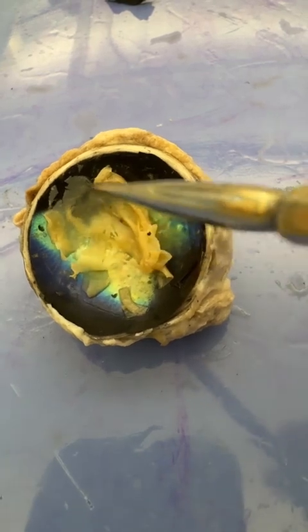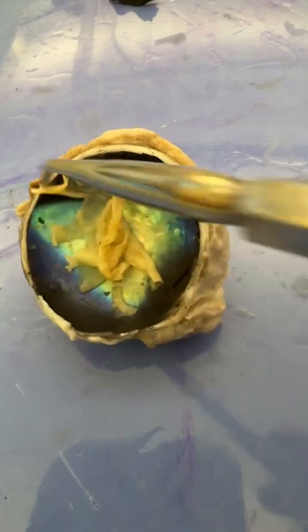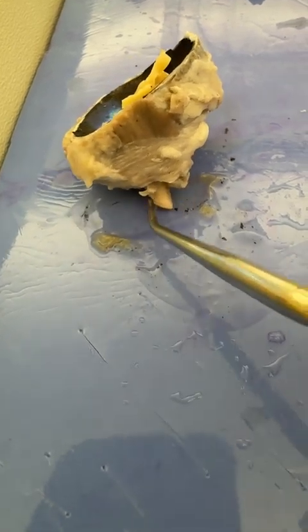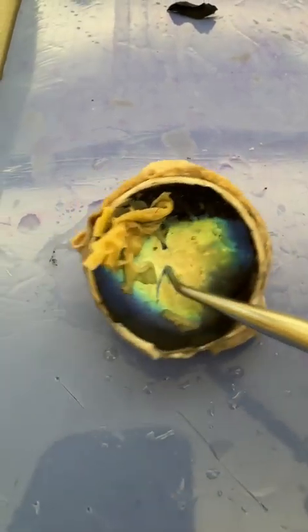All right. So there's the retina. It all attaches at this one point, and that one point is going to take all that out to the back side, if I can get it to flip. That back side is going to have the optic nerve. There it is. You can kind of see it, this little guy. So there's the optic nerve. You follow that straight through, and that's where the retina attaches. And that happens to be the blind spot.